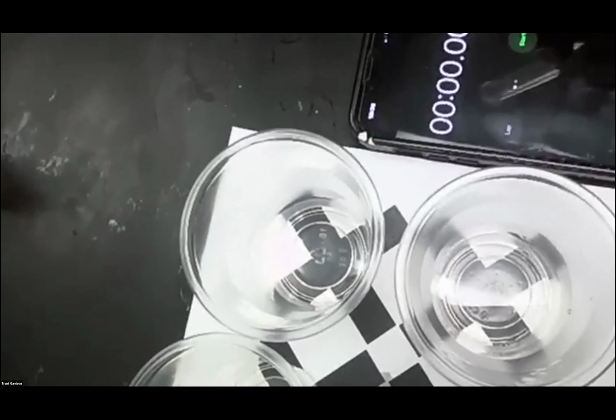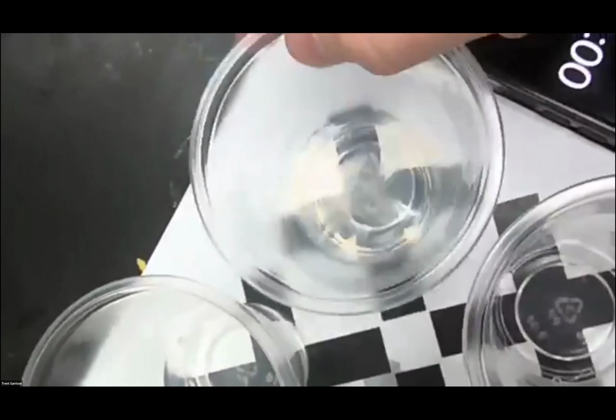So now what you're going to see is an overhead view of the first container. And in the view of this first container, I'm going to keep my stopwatch in here so that you can see how we're doing it. So here's my acid. As soon as I pour it in, I'm going to start my camera time. So boom, I start it, and I am now going to pour it in. So now my acid is in there, and we are waiting for a point where we can no longer see the X in the bottom of the container. It will be a slow process, but it will eventually occur.